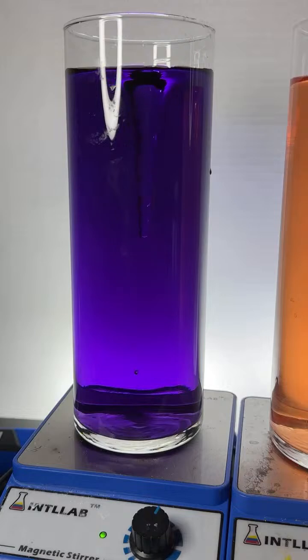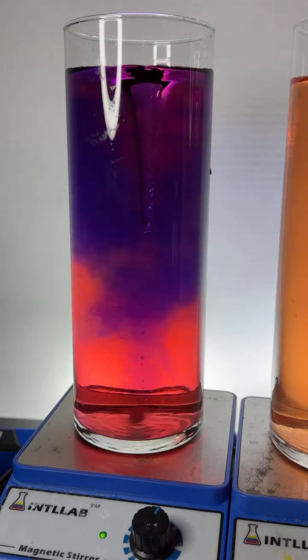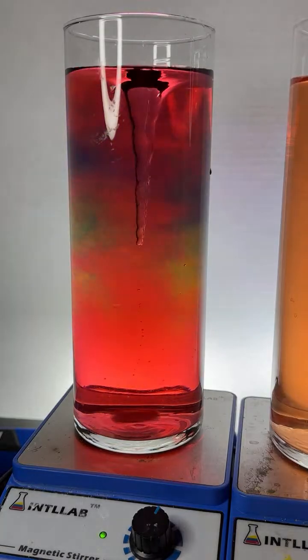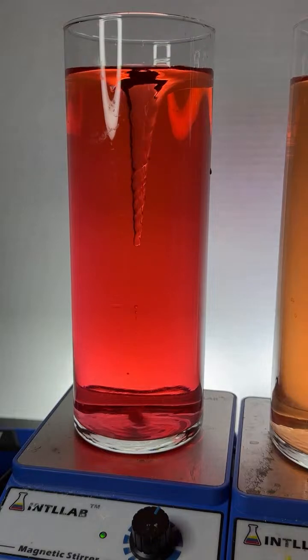What gas makes water more basic? That's an interesting question. Ammonia. If you dissolve ammonia gas into water, it's going to become more basic. We are getting some interesting colors here. Yeah, Peblo, it is dark. That's because I've put quite a bit of universal indicator in here.